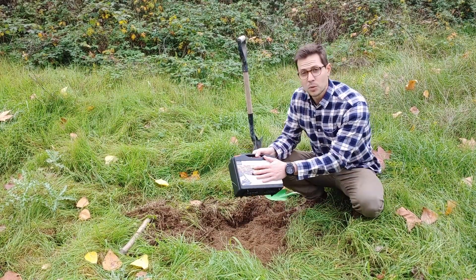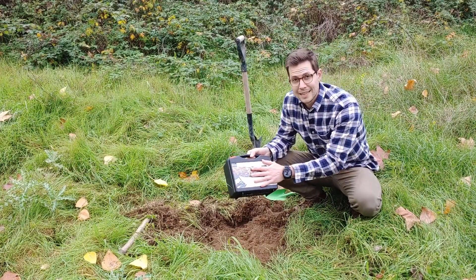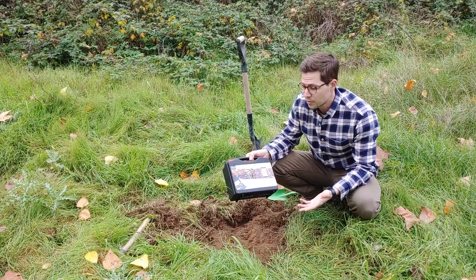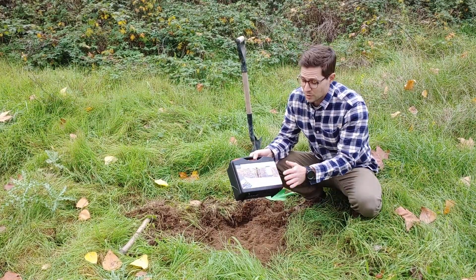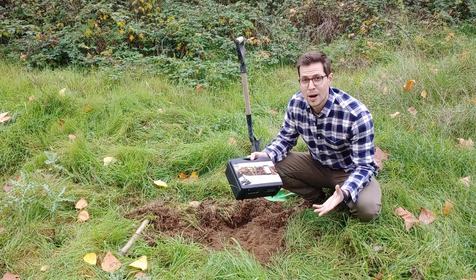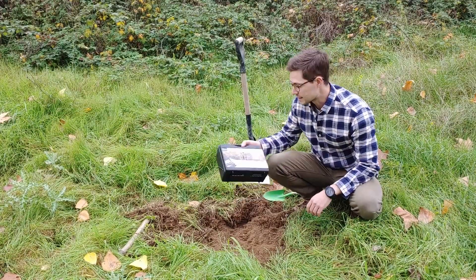I'm showing you with the kit here, but I wouldn't normally bring it out into the field. You don't need the material inside to actually gather the soil samples. There are a lot of small moving parts, so I normally leave this at home unless you need results right away. It's just as easy to bring the soil sample back inside.